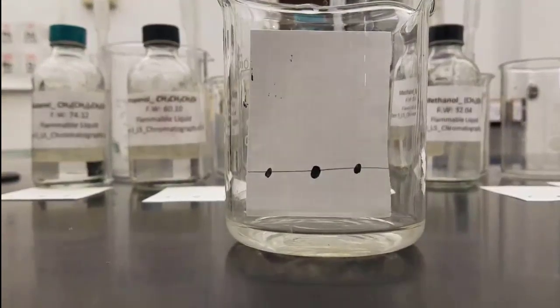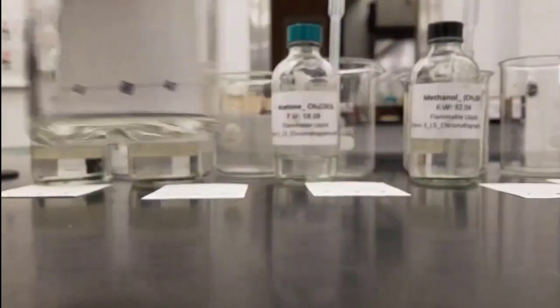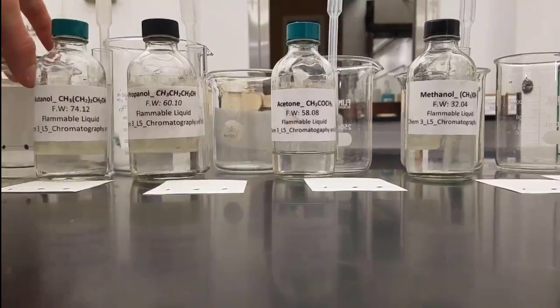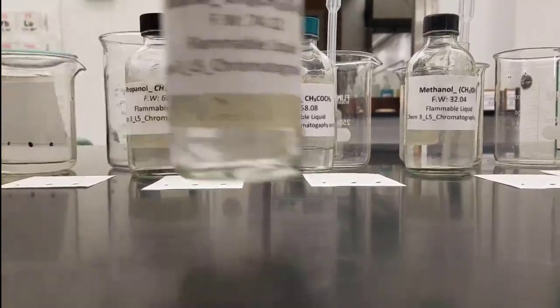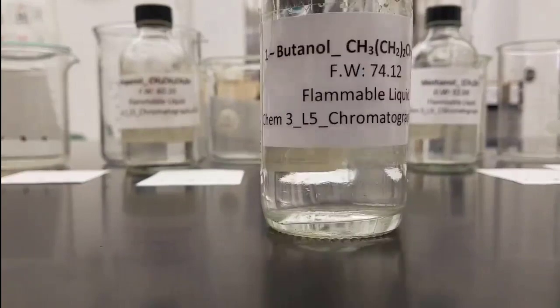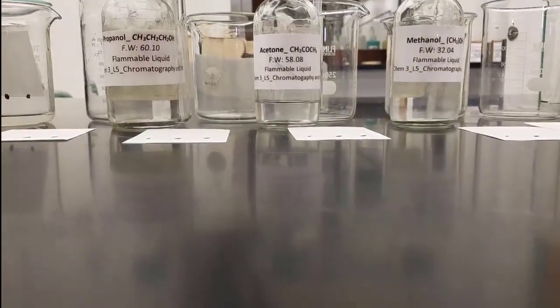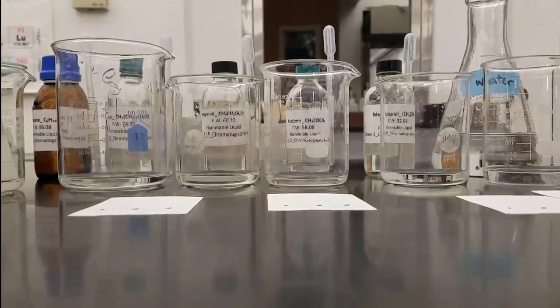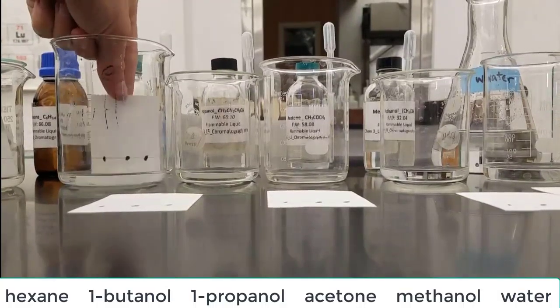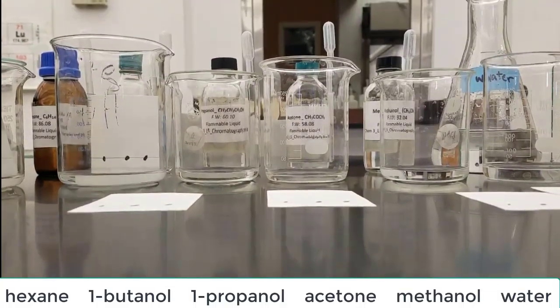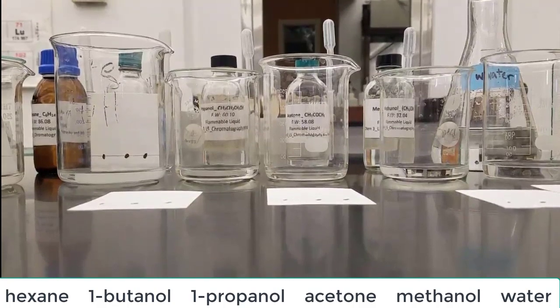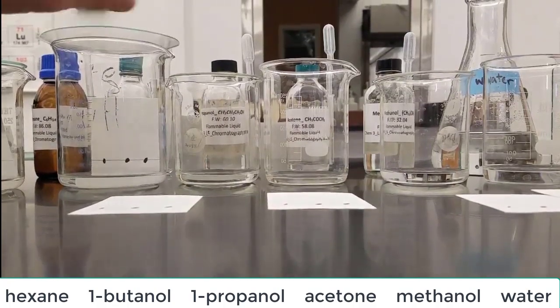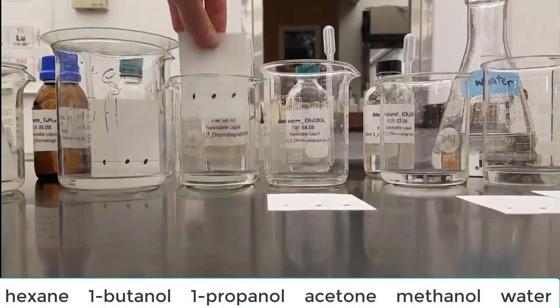The paper is now set in there with the lid on top of it, which is just a watch glass, and little by little you can see that hexane moving up. Next beaker gets butanol. The paper goes into the butanol and we'll let that sit for about five minutes or so while the butanol soaks up the paper.